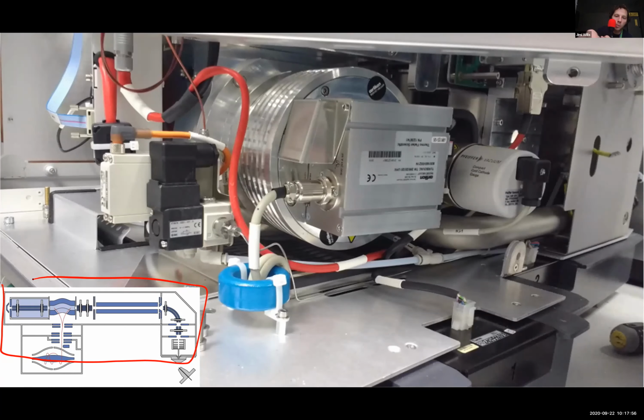So this, for example, is a turbomolecular pump. On the floor underneath this bench, there's a coarse pump that generates a really strong vacuum, probably better than any vacuum cleaner can do. Well, certainly better, really. But this thing then takes individual molecules and pings them out of the internal space of the mass spec, so that there are no molecules in there that can interfere with your ions that you're trying to control. And at the top, there are lots of circuit boards.